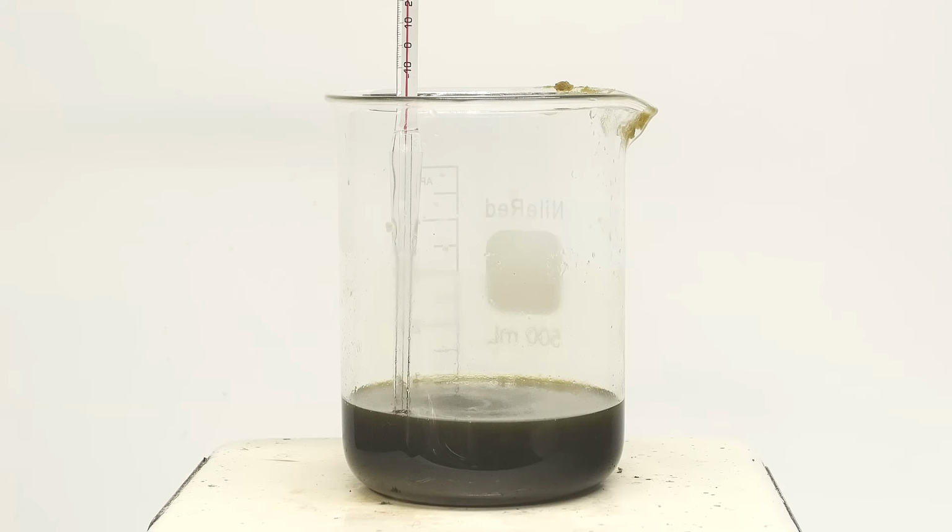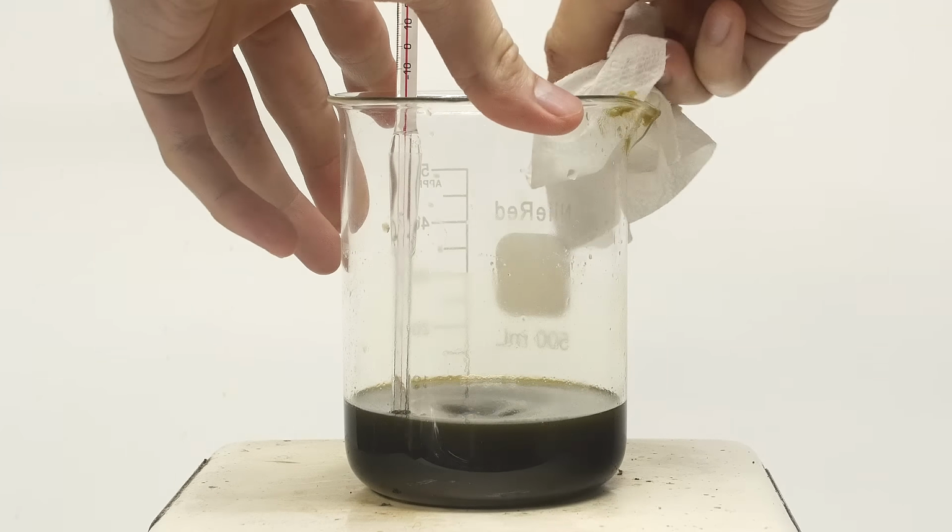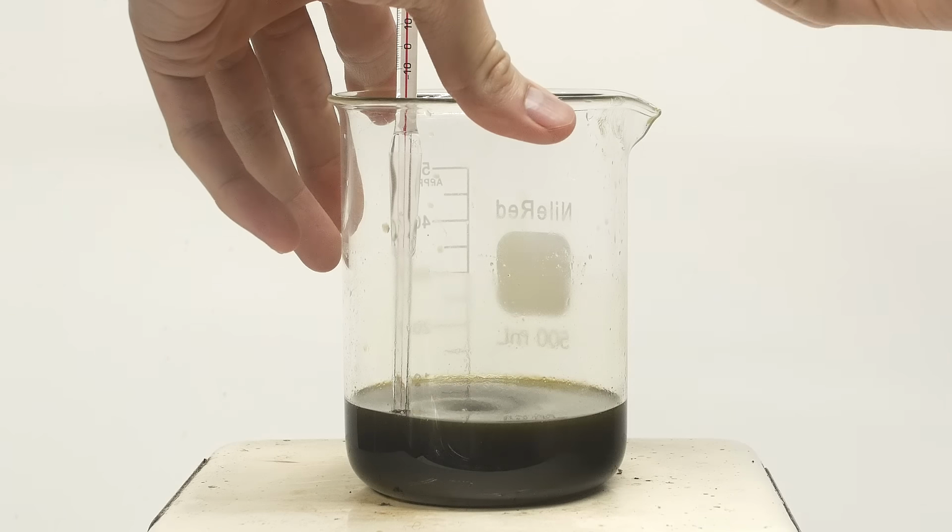I have no idea the exact composition of fatty acids I have here, so I had to assume that it was all oleic acid. Oleic acid is the most abundant fatty acid in olive oil, but it definitely doesn't represent 100%, so the numbers are going to be a little bit skewed.